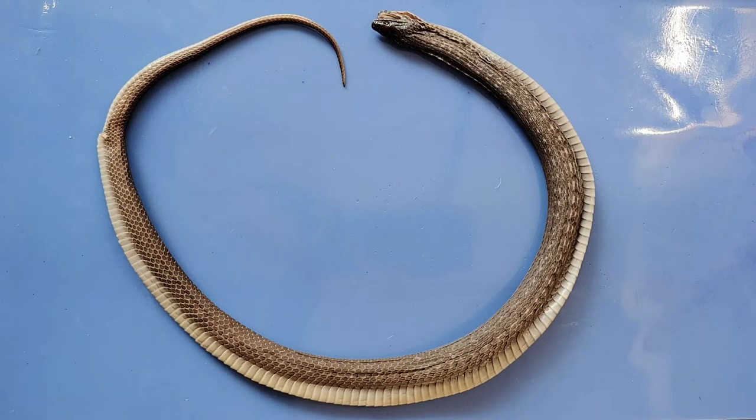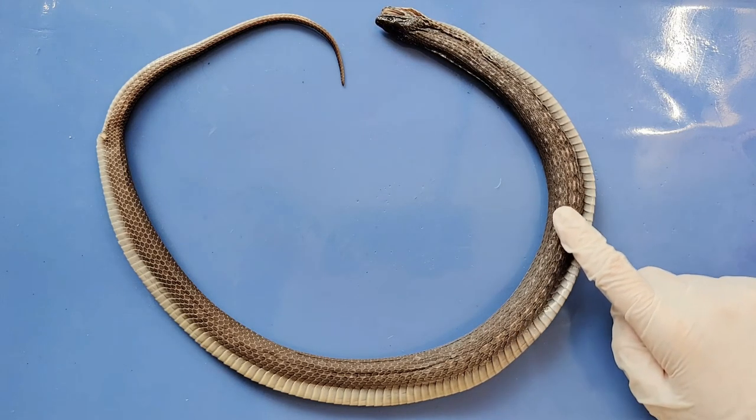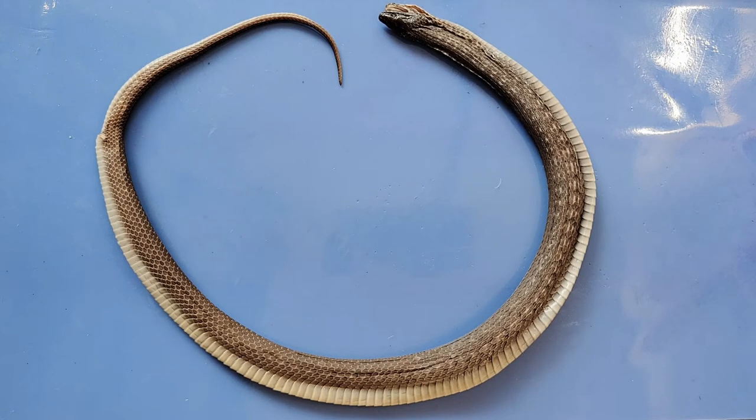Hello and welcome to O-Wyrm. Today we'll be taking a look at the anatomy of a snake. This specific snake is a non-venomous garter snake. As you may already know, although snakes get a bit of a bad rep, they are incredibly important organisms in our ecosystem, and they have a beautifully unique biology that's fascinating to learn about.